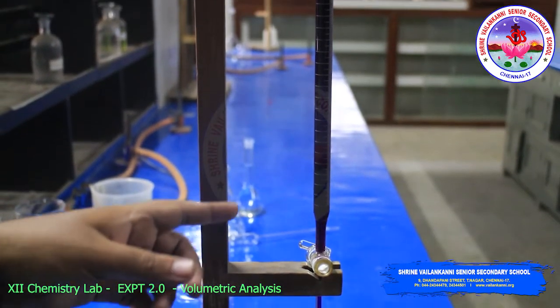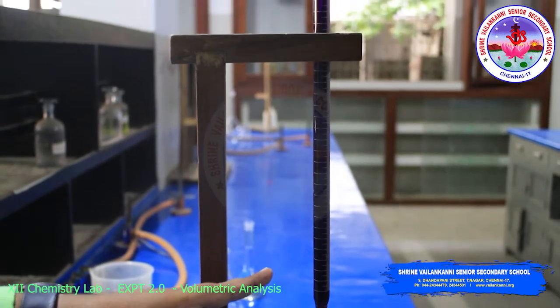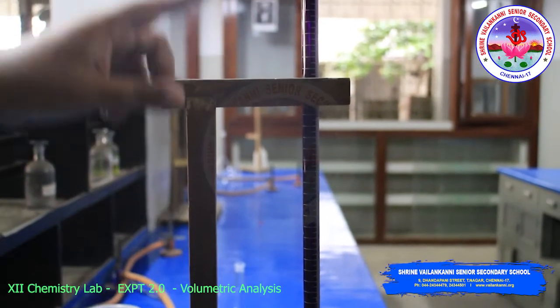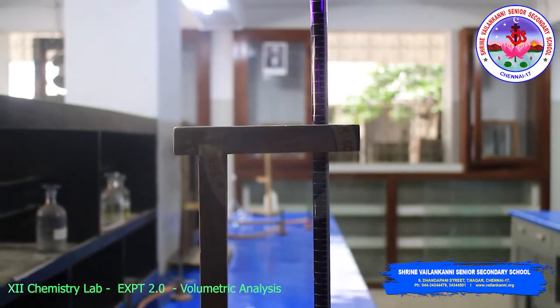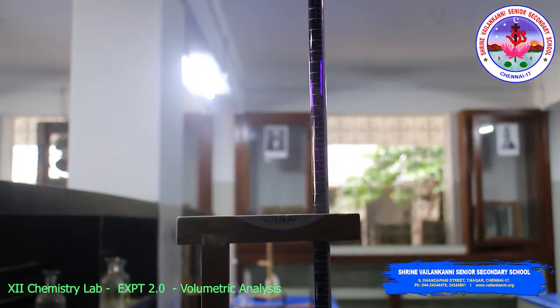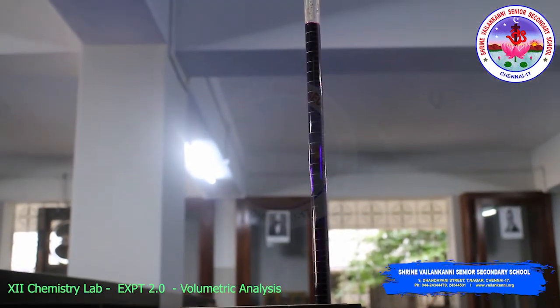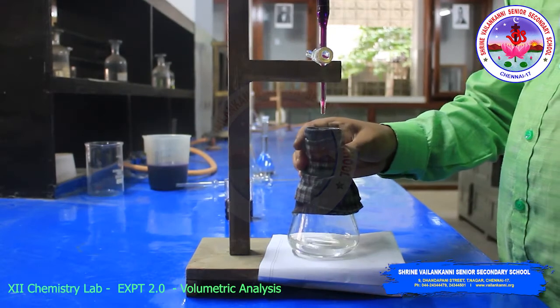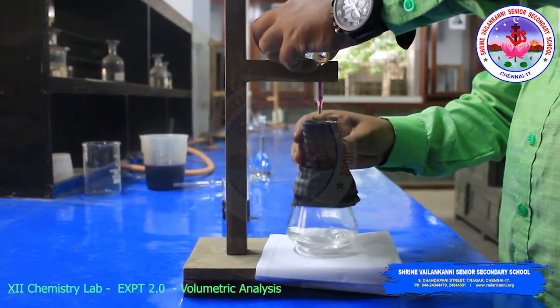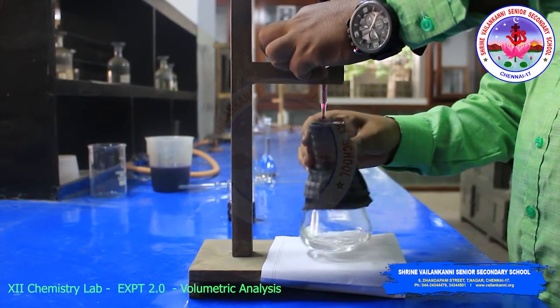See students, this is burette solution. This contains potassium permanganate. Already I filled this. Before filling this solution, you have to rinse the burette with potassium permanganate solution. Now we have to titrate the solution. Slowly add drop by drop.